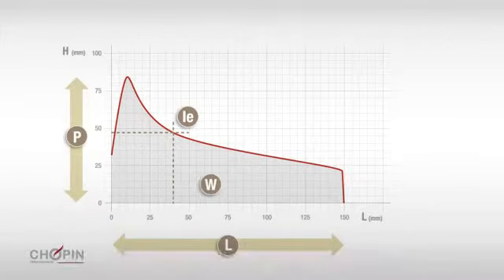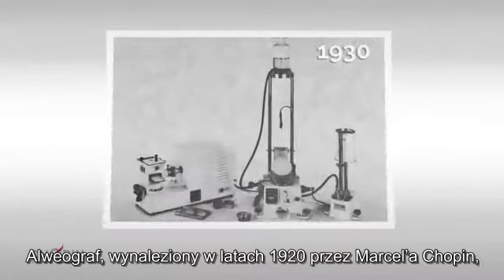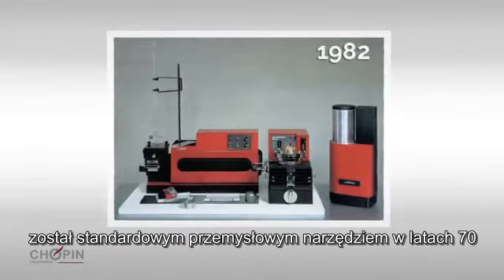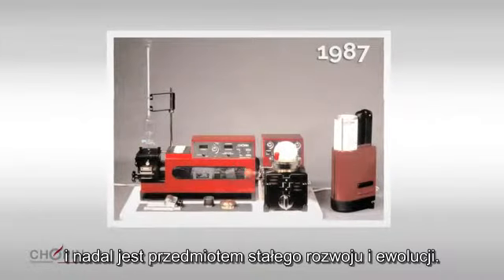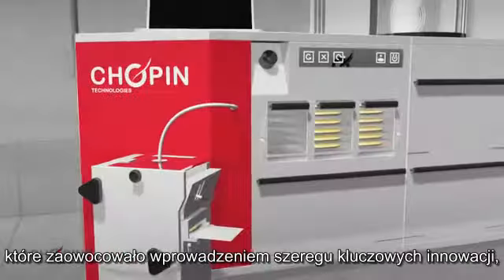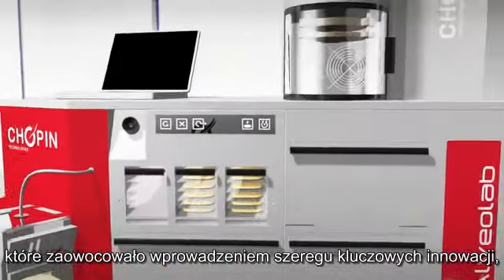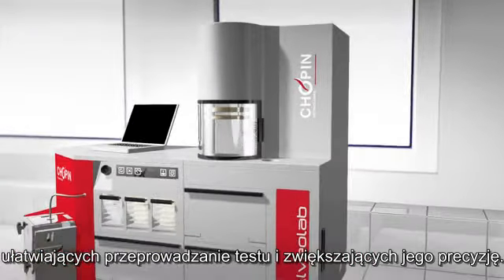The alveograph, invented in 1920 by Marcel Chopin, became an industry standard tool during the 1970s and has been subject to constant development and evolution. The Chopin Alveolab represents the fruit of over 80 years of experience and today benefits from a number of highly significant innovations that make tests easier to carry out and more precise.